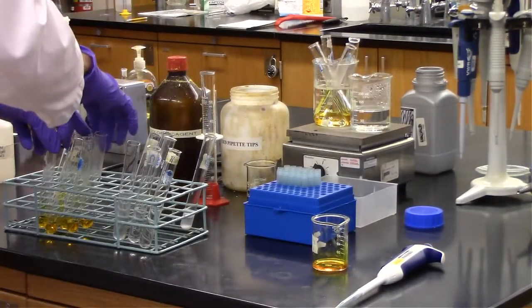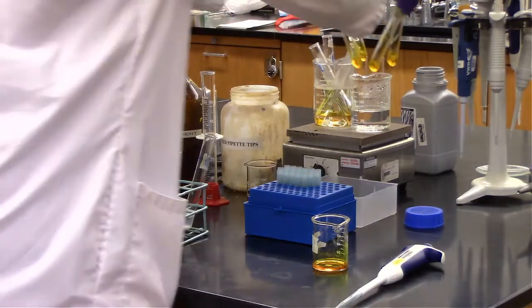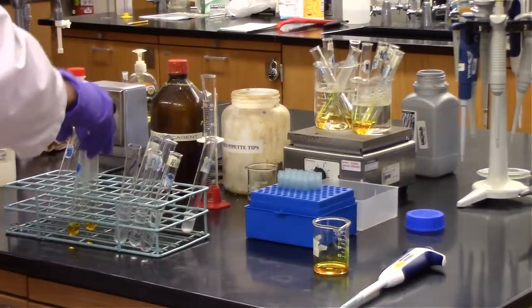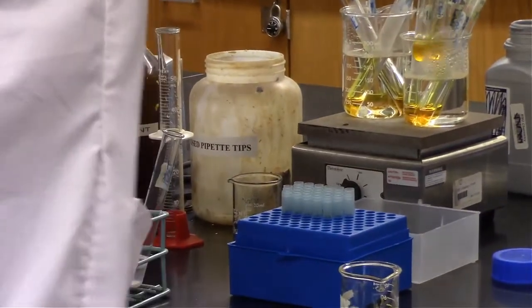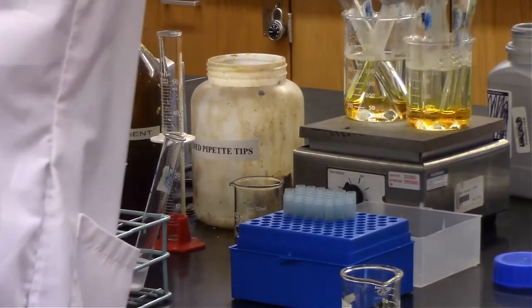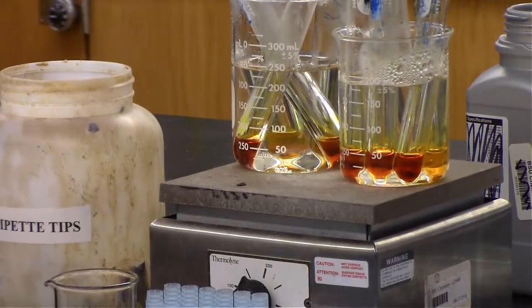So hopefully within the hot water bath we're going to see some differentiation between the test tubes, and my guess is that at 37 degrees Celsius, which is approximately body temperature, we're going to get a little bit more reactivity from my alpha-Amylase breaking down a little bit more of that sugar. See how much darker it is?